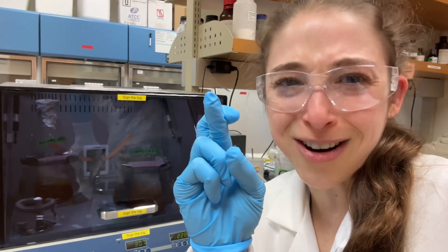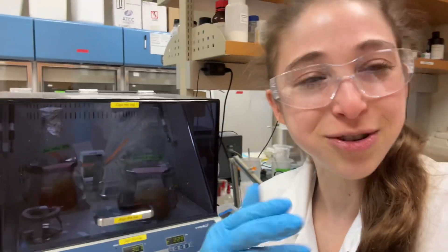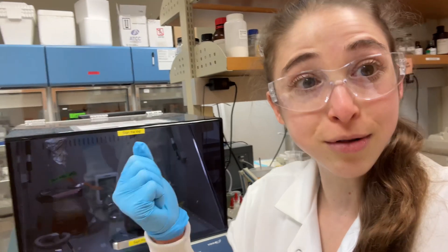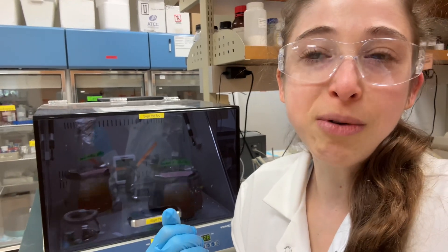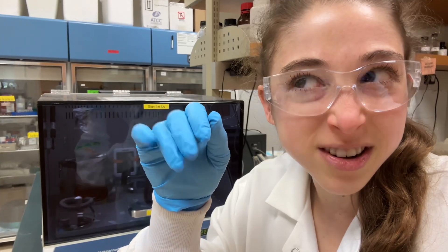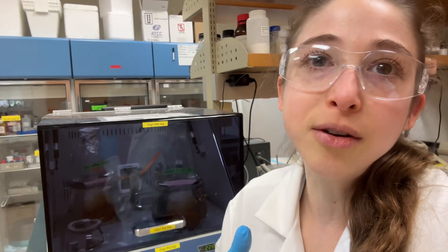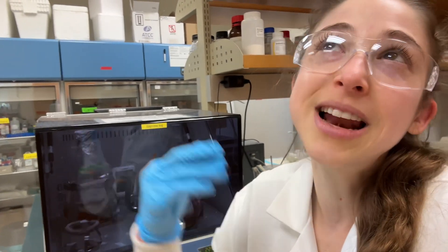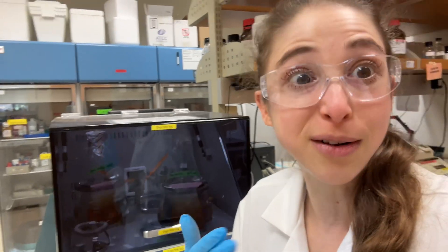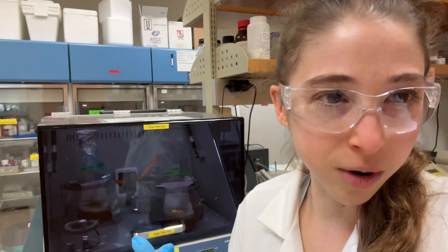Finally getting around to trying auto-induction for the first time. It's basically a way to get bacteria to make a protein on demand without you having to wait and monitor and tell it exactly when. It's more like you schedule the on-demand ahead of time so you don't have to keep watching it.